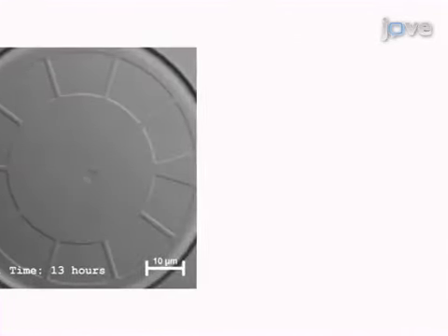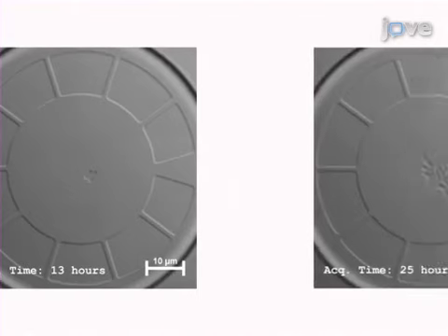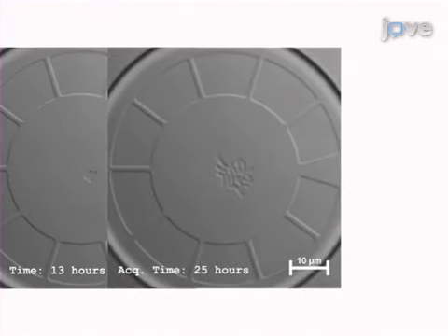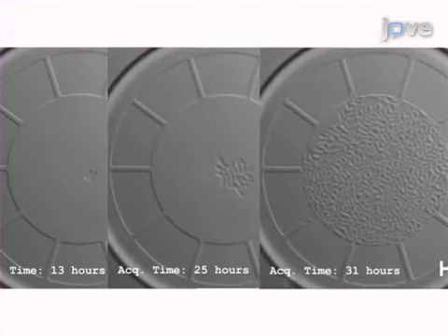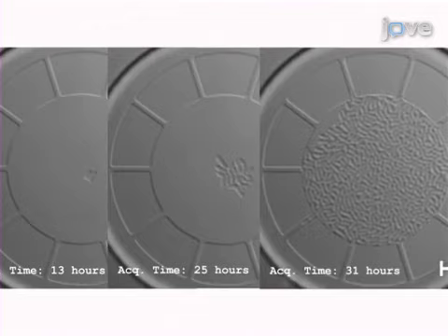Microbial culture is then infused into the microfluidic device to inoculate single mother cells within the bioreactors. These cells are expanded by continuous infusion of growth medium through the system.